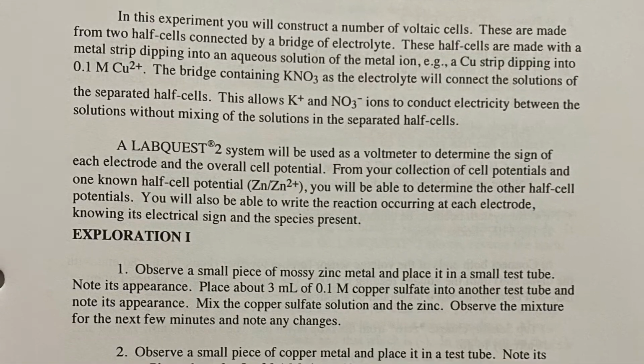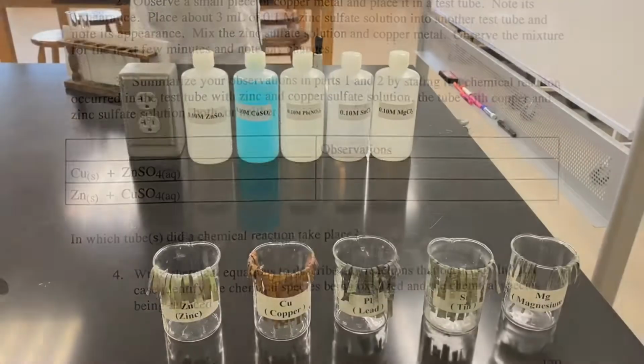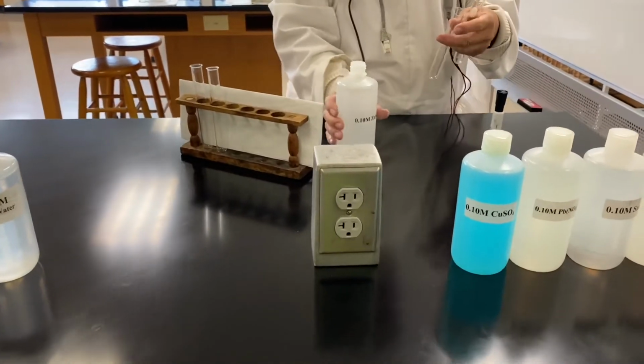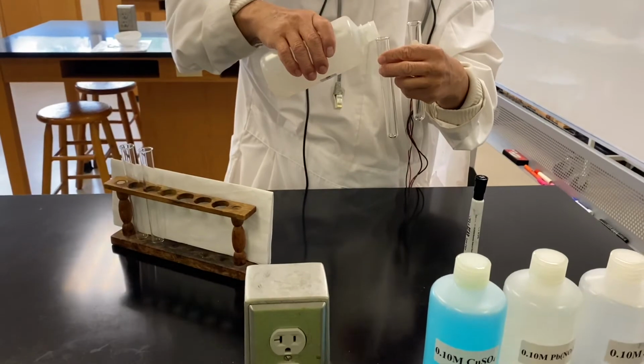This video covers the electrochemical cell potentials experiment, where you will be constructing a number of voltaic cells. We will first do Exploration 1 on page 179.